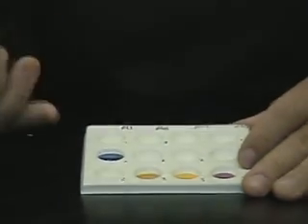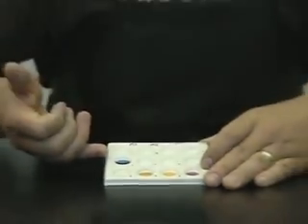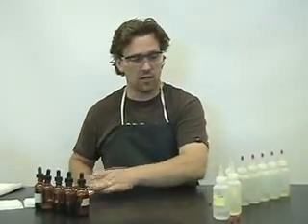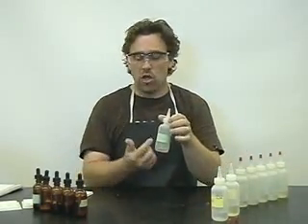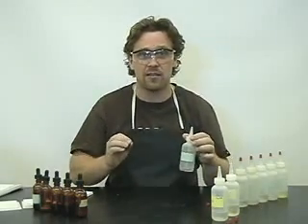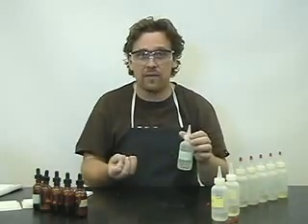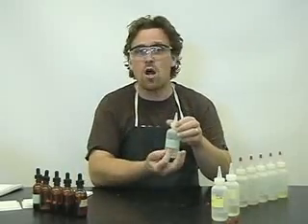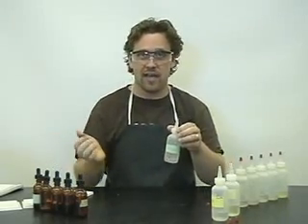Lastly, we see a blue color. Wait — the strong acid also showed a blue color! Therefore, unknown acid 1 shows all the same colors as our strong acid. If it shows the same color as our strong acid did, therefore it is stronger than all six indicators.